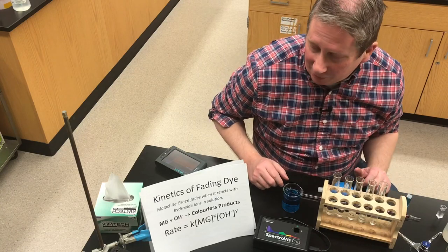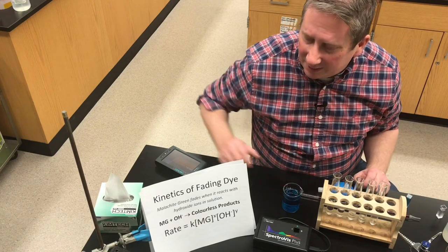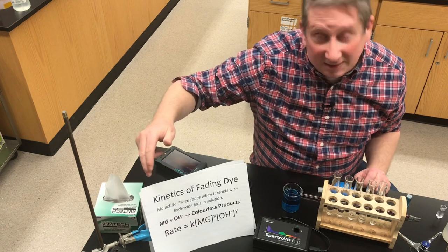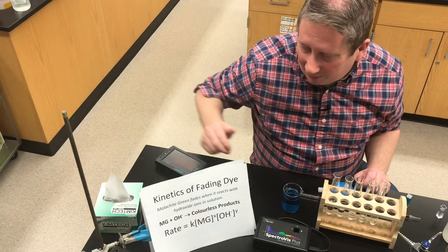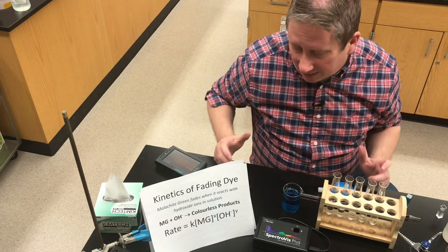Welcome to another lab video for advanced chemistry. This time we're looking at a kinetics experiment — the kinetics of a fading dye.